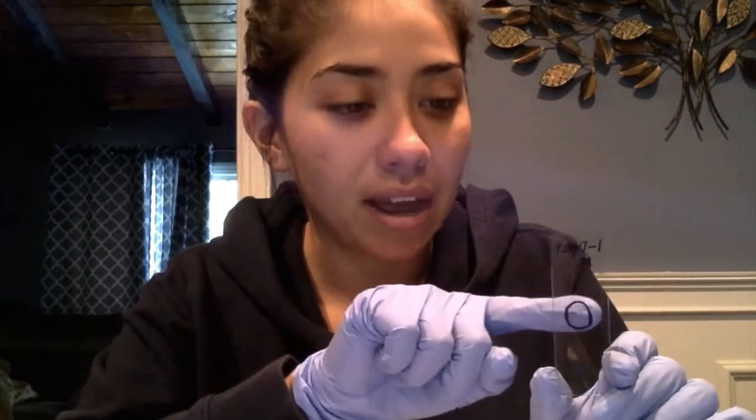Hi, my name is Sarah Saldana and today's date is January 25th, 2018. In this video I'm going to show how I obtained a direct and negative stain from a sample of my teeth and gums. The first thing I did was I labeled one slide 'one direct M' — one meaning it's the first slide, direct meaning this was the direct stain, and M because the sample was from my mouth. I drew a dime-sized circle on the back of the slide to mark where I was going to place the sterilized swab used to collect microorganisms from my gums and teeth.